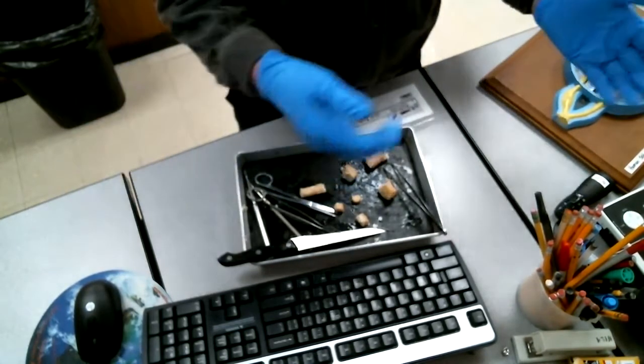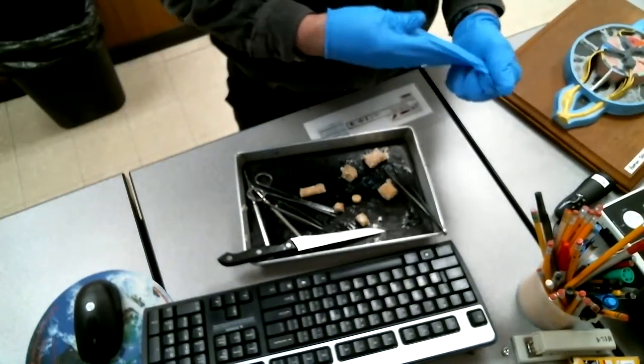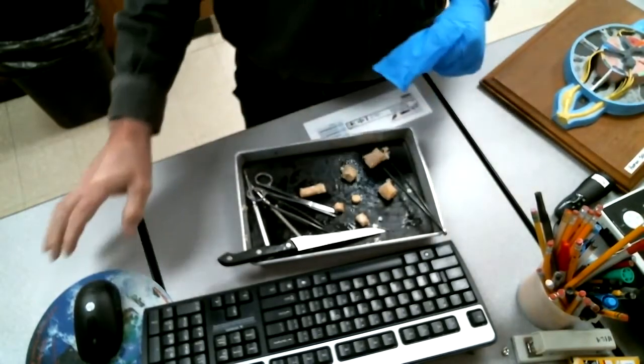There are instructions that are available online to help you with this. Okay, so let's turn this back up here and get an idea what I look like. All right, so look at the instructions, look at your lab manual. There are nice illustrations of the cross section of the spinal cord. That's our focus. Go through the whole exercise though, do an exercise 18 review.